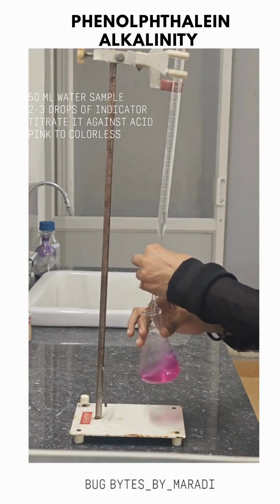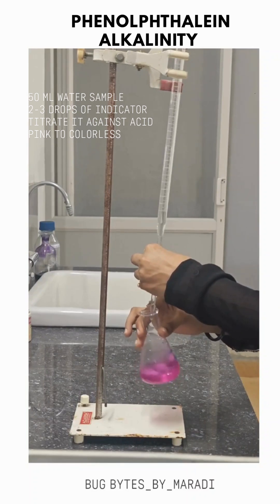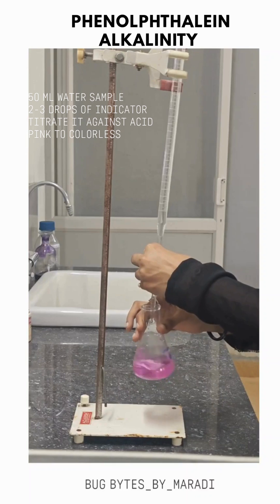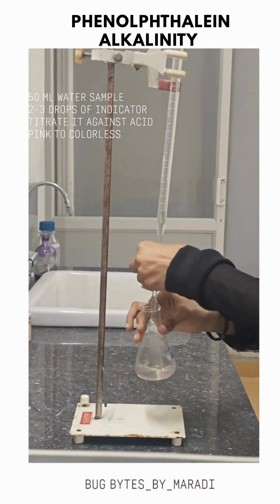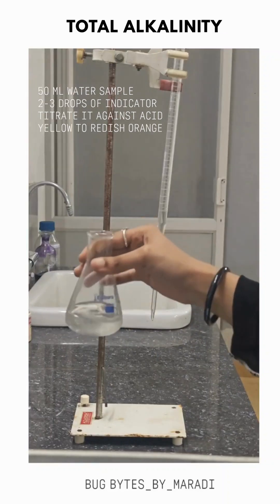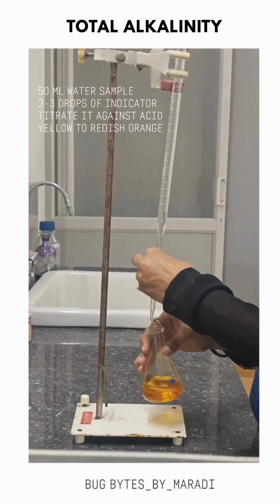Titrate against 0.1 normal HCl or sulfuric acid until the pink color turns colorless. Phenolphthalein indicator turns pink only if the water contains a base or alkali at a higher pH — more than 8.3.